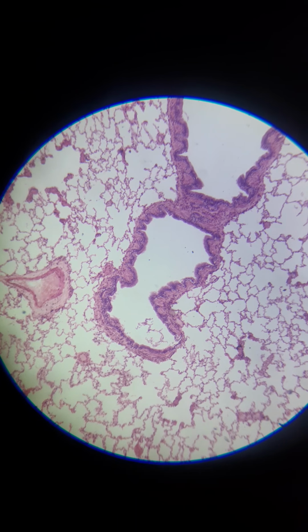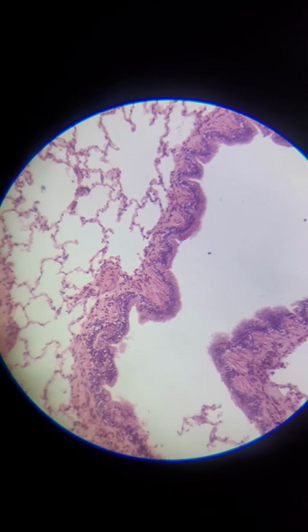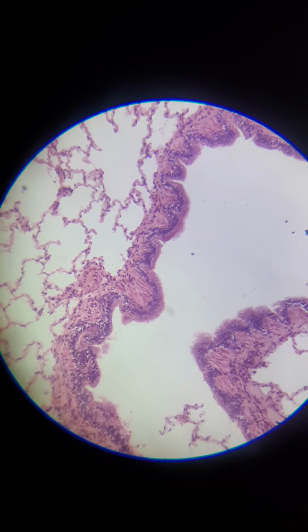So when you have these big segments here of nothing with the really thick border, that's actually a bronchiole. So that's where the air is going before it gets into the alveolar sac. And you can usually tell because the inside edges have that squiggly shape to it. Why don't we zoom in on that? There's a couple things to see. Okay, we're going to zoom in one more.